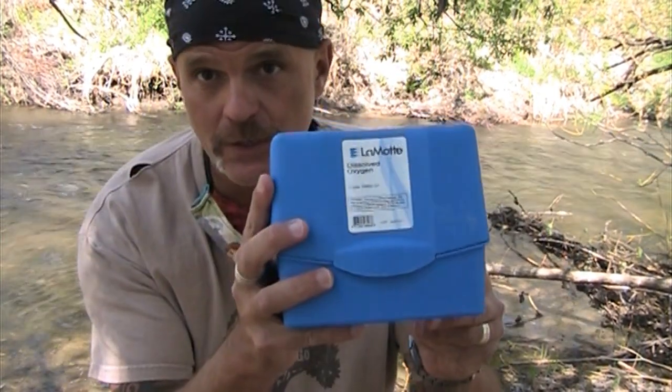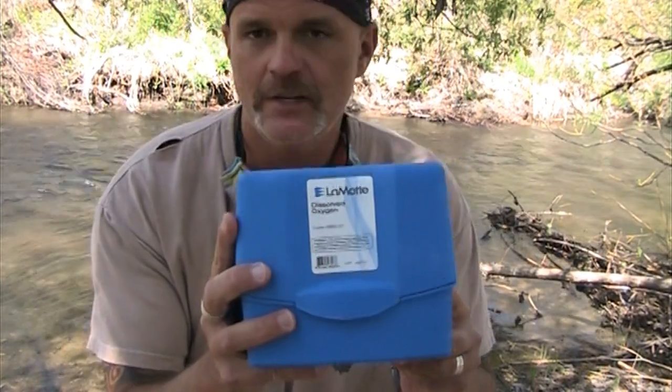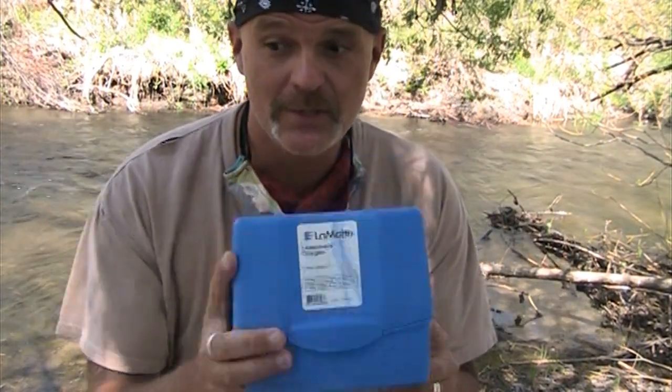Now let's say you want to measure dissolved oxygen. So you can go to the science lab and grab all of those weird sensors that never quite work. I actually don't like using electronic sensors. In field research, we started using them because they were highly maintained, highly tuned, but we always check them with a chemical titration. The dissolved oxygen test from LaMotte, which is a Winkler titration.